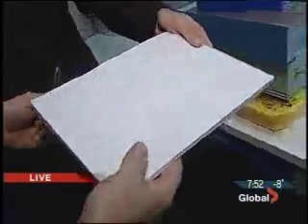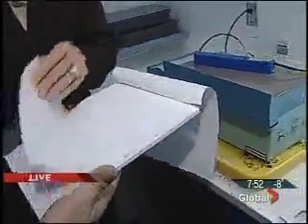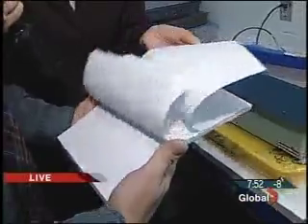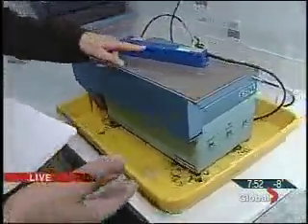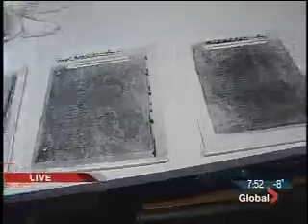Now, in this particular case, we had a situation where a youth was found deceased in the residence, and they were trying to determine whether we're dealing with a homicide or a suicide. And what happened was they took the pad of paper that they found by the body and brought it to the lab, to the documents section for examination purposes. The indentations on this note were found on different sheets on the pad of paper using the ESDA, or electrostatic detection apparatus. So this machine will do what?